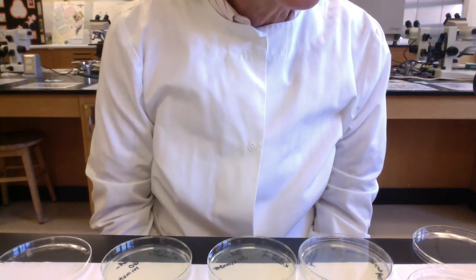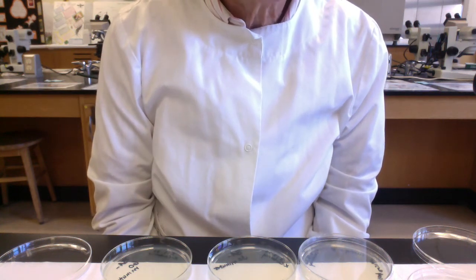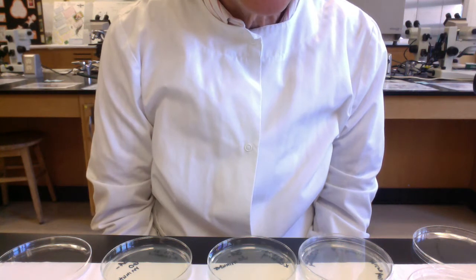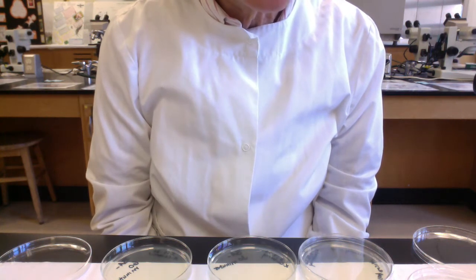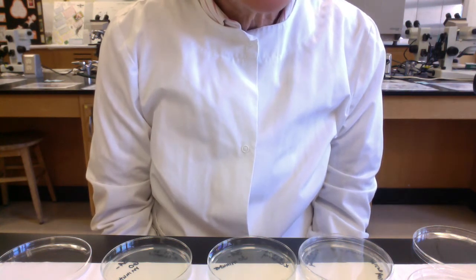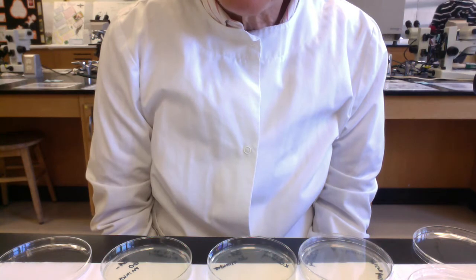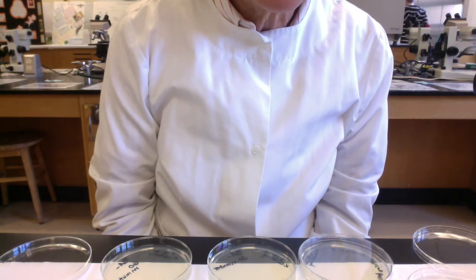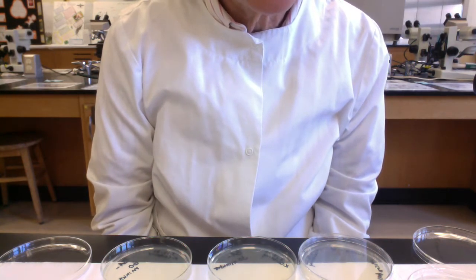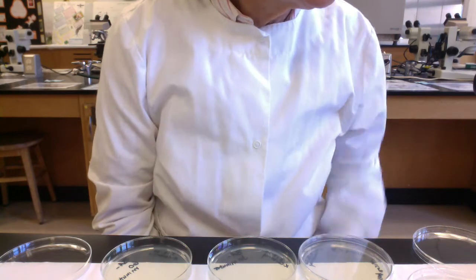Hi micro folks, we're continuing our lab videos for Chapter 10 Microbial Growth. We've just started exploring our selective and differential media. The previous video we talked about the enrichment and differential media blood agar.